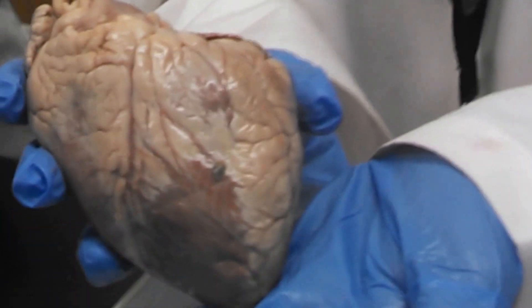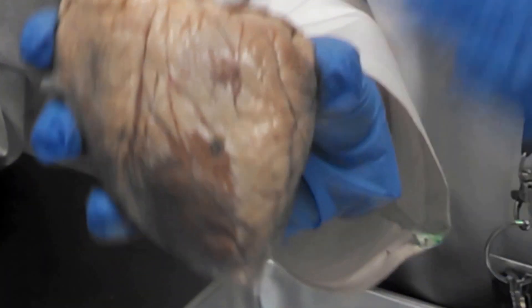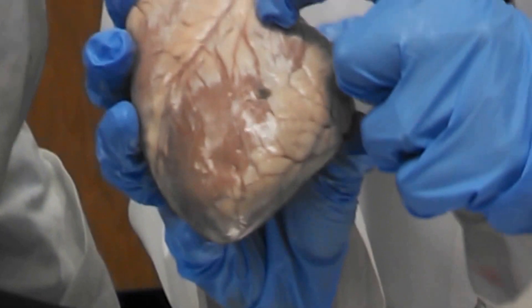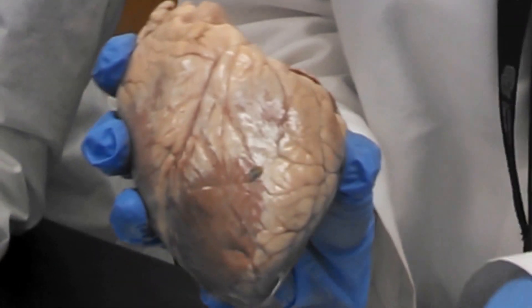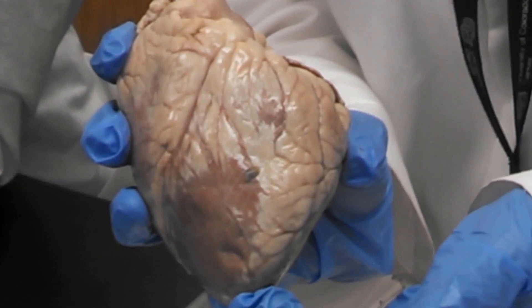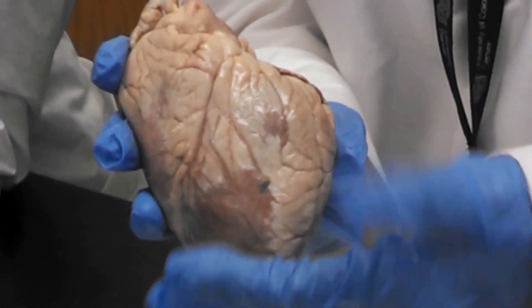The ventral side of the heart — the side that faces out of the chest — and we have the coronary artery running down one side of the heart. Here we have the apex of the heart at the very bottom, or inferior.